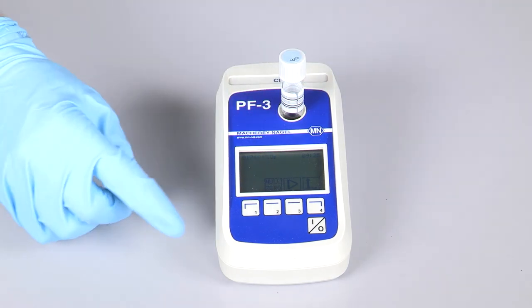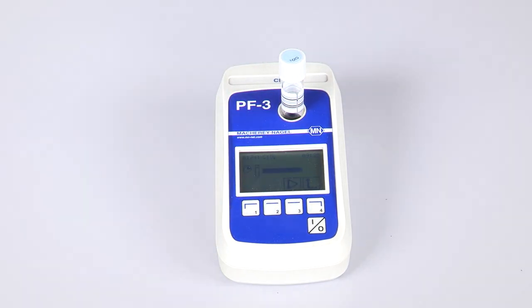Insert the cuvette into the photometer and determine the Chlorine Dioxide concentration.